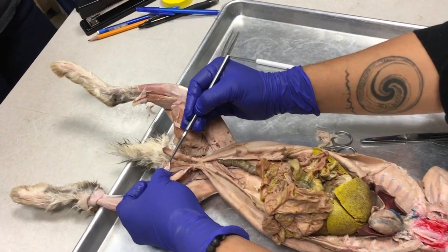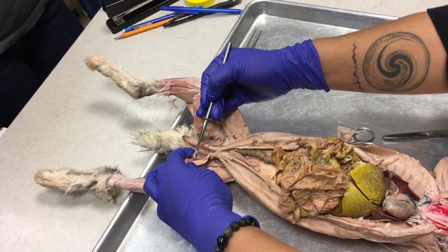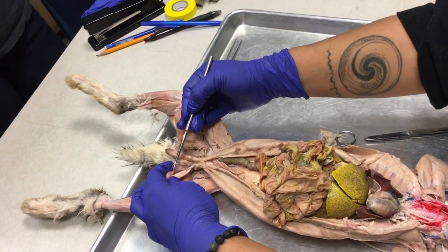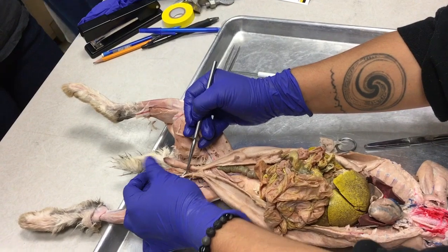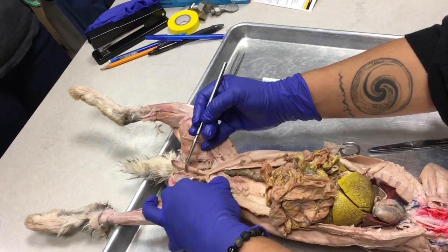And then from the epididymis, you see there's a duct coming from it, and you can see there's a pink and a blue too. That's the testicular artery in pink, testicular vein in blue. The duct is the vas deferens. Now, these testes are outside the body so that they're the optimal temperature to produce working sperm.